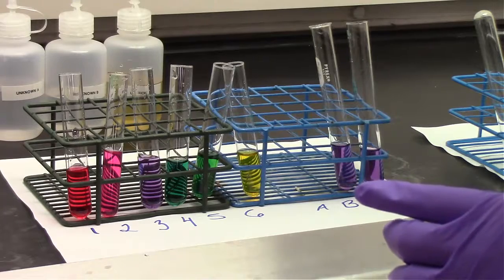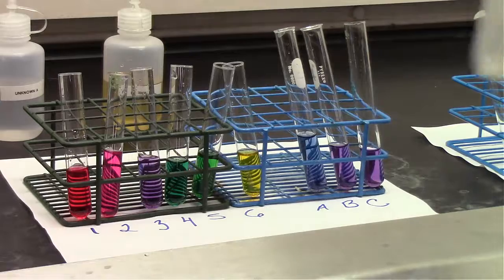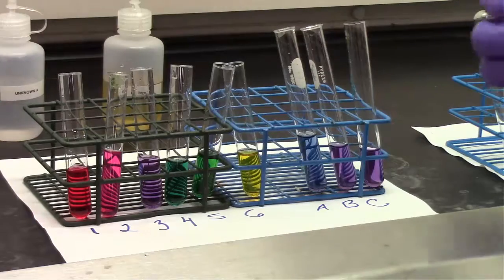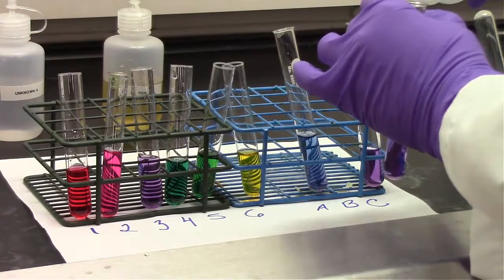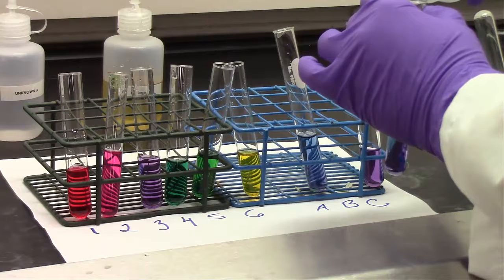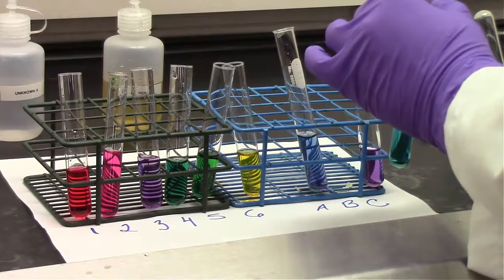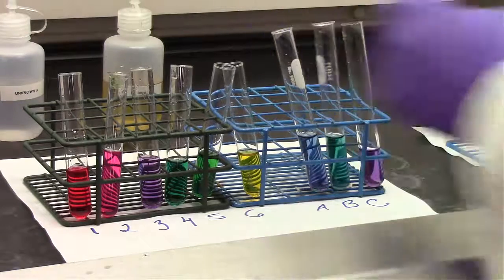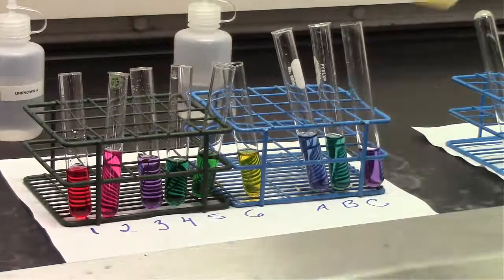So for test tube A, it looks like I don't see a blue test tube in my mix, but I think that color between purple and green is probably that. So I'm going to guess the pH is somewhere between test tube 3 and 4, and from the reference table that we saw a little bit ago, as well as on your worksheet, you should be able to predict the approximate pH of the unknown A. For unknown B, that matches up a little bit more closely to some of the test tubes that we have.